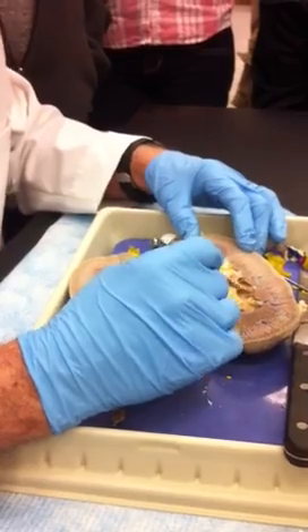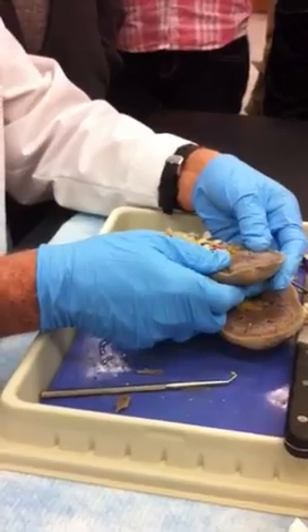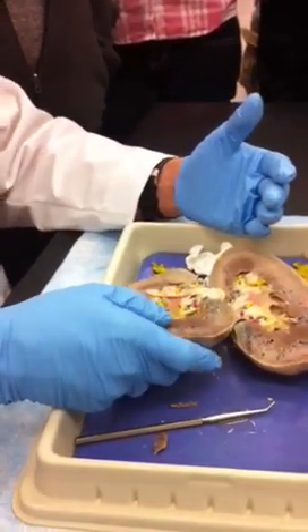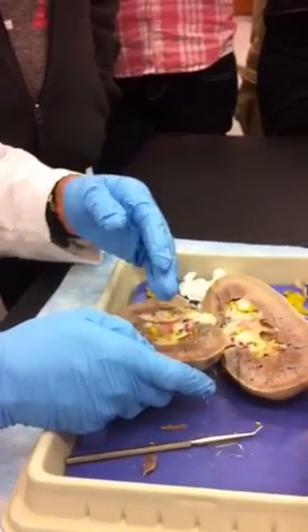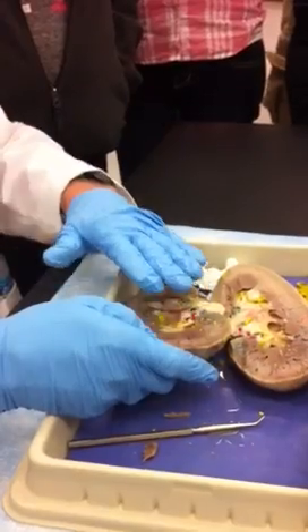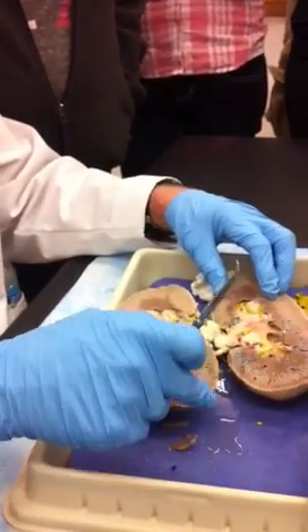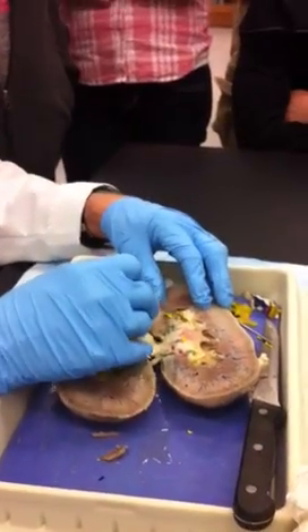If you look carefully, you can tell that this pyramid has ducts in it — can't you see those lines? What I wish it had was some of the yellow going up into the papillary ducts and the collecting ducts. The latex was under such pressure it pushed right up through those ducts. She got a lot of arteries in there. There's another minor calyx — see it? Up in there.